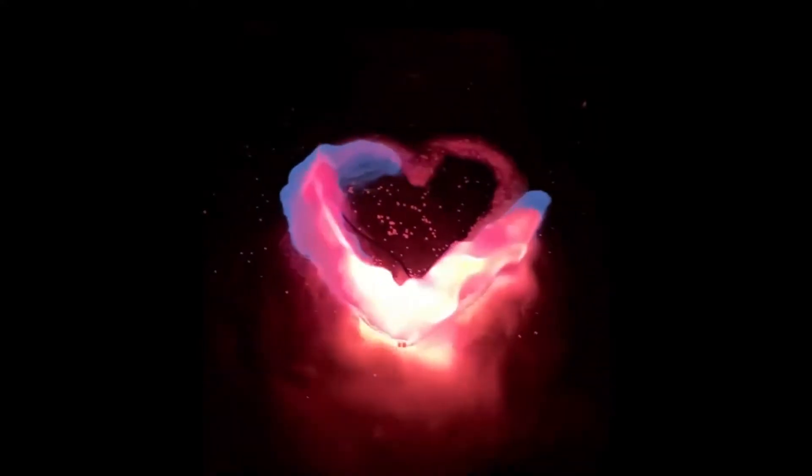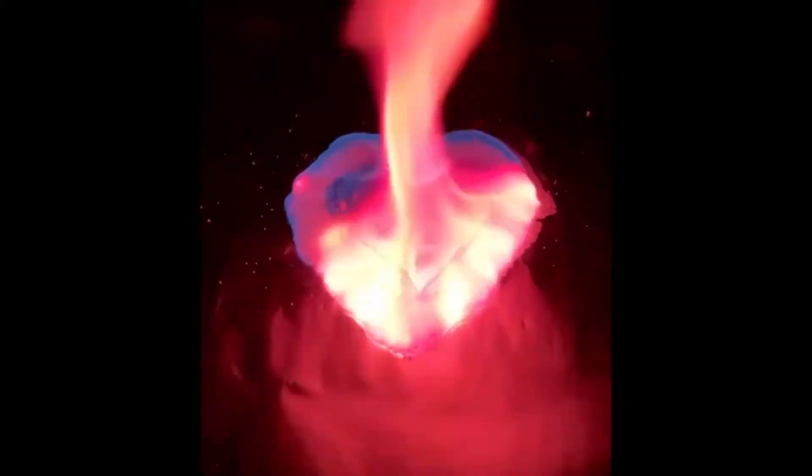Before we get to the experiments with the batteries, I want to share just one more property of lithium with you. When you heat lithium compounds in a flame, they give off a beautiful scarlet red color like the one you see here. I'm really hoping that I'll be able to extract the lithium from a battery and generate this pink colored flame with some of the lithium that's contained in the battery.